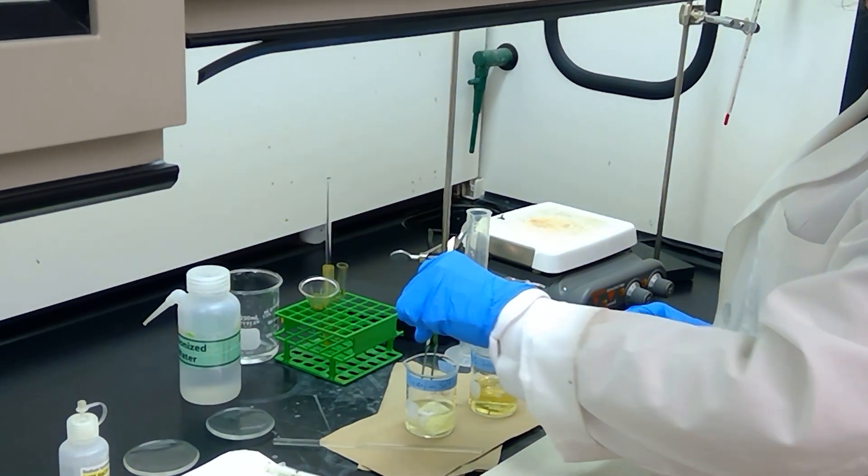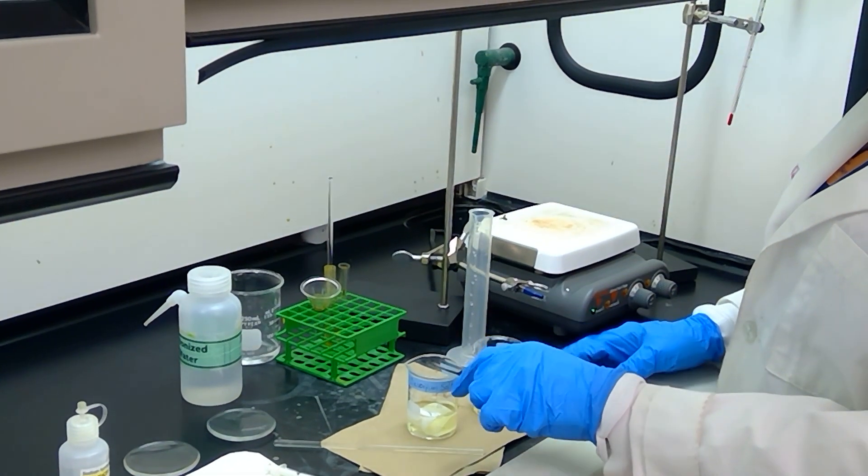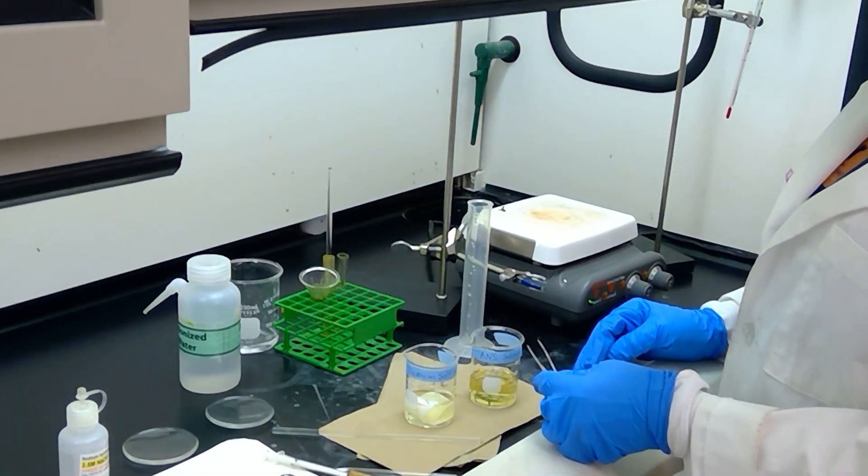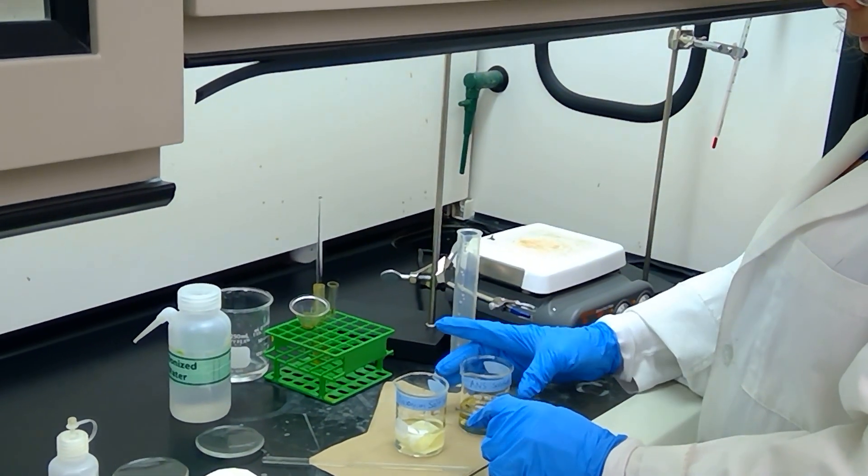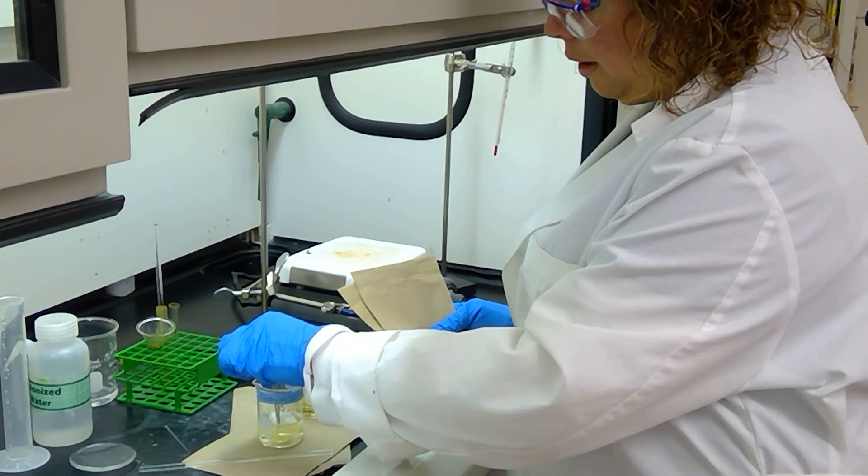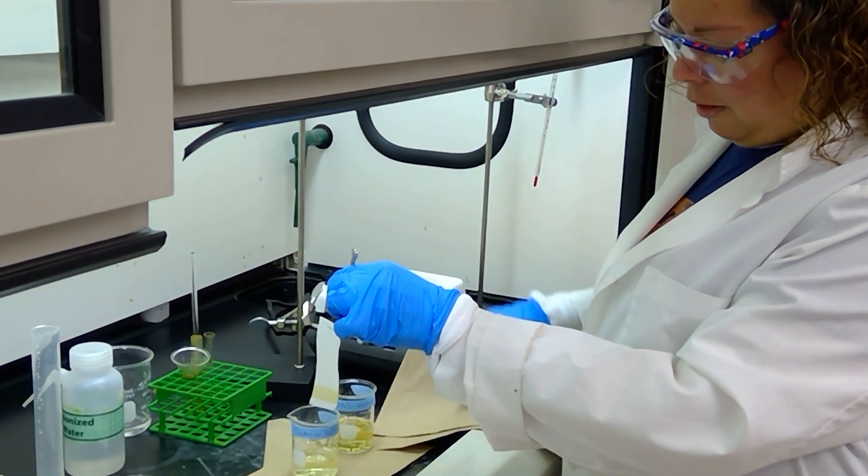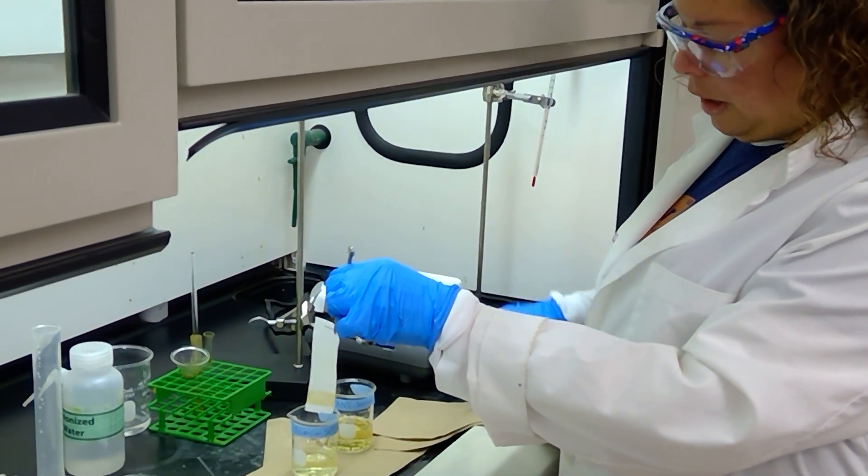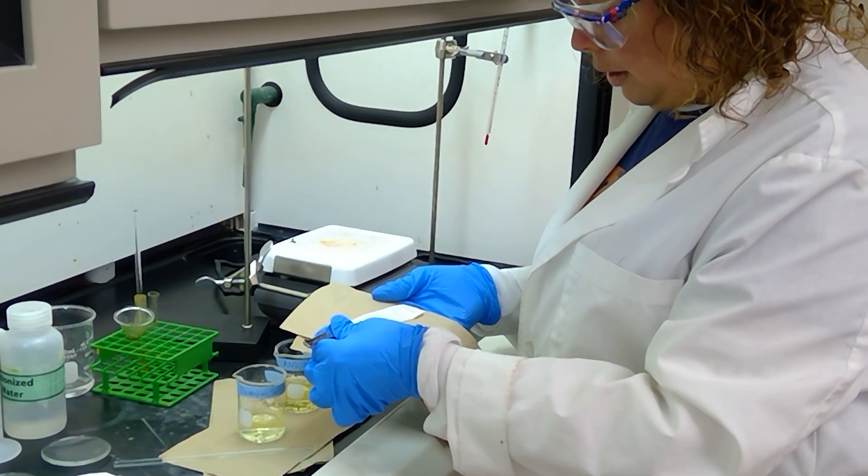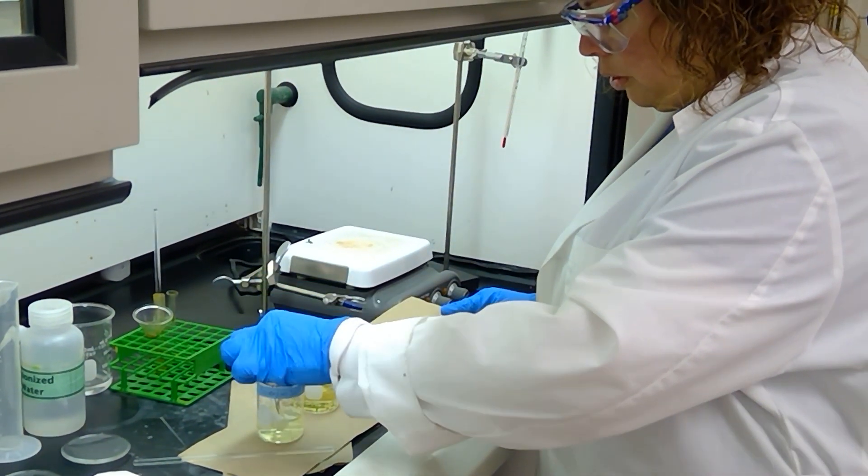In your textbook, the instruction says to start with the ANS, but in reality, you can start with either solution and then move the fabric to the next compound. Okay, so it's been about a minute or two, and my fabric strip has been immersed in the diazonium salt solution. If you notice, even the wool fiber down at the bottom here is turning slightly yellow, so that indicates to me that we have some good absorption going on here. I'm going to go ahead and just rotate it one more time.